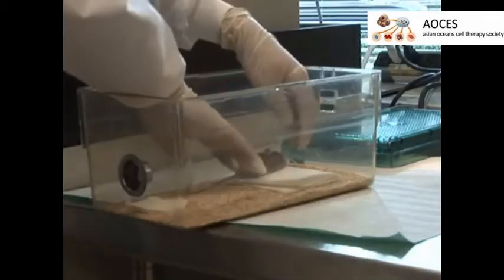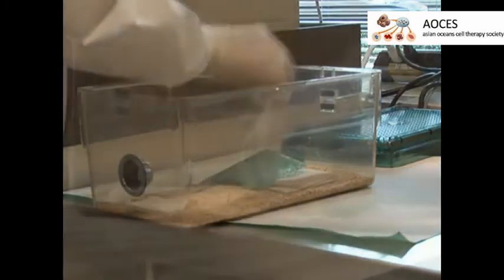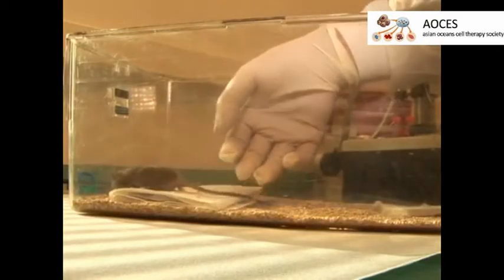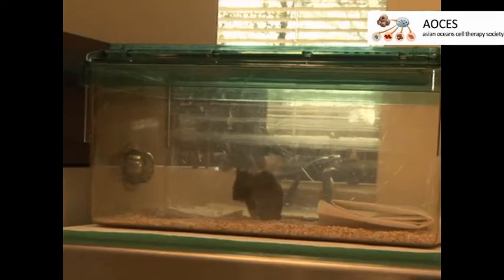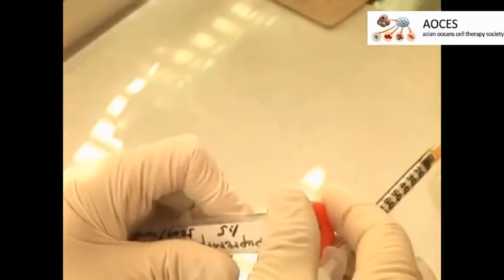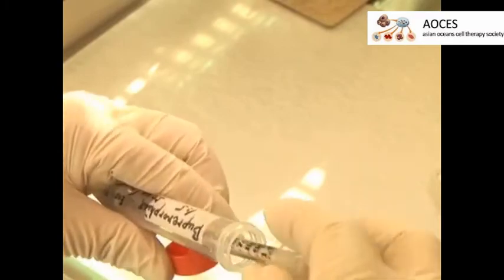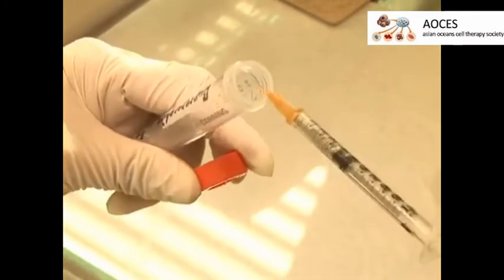Finally, move the mouse to a warm and dry recovery area. Monitor the animal until it has recovered sufficiently from anesthesia to maintain an upright posture, then return the animal to the home cage. Ensure that the animal is monitored closely and administer systemic analgesics and topical antibiotics twice daily for the first 3 days following the optic nerve crush procedure.